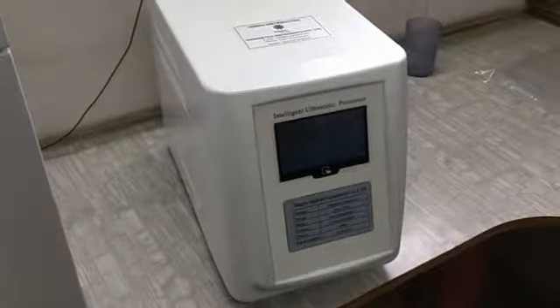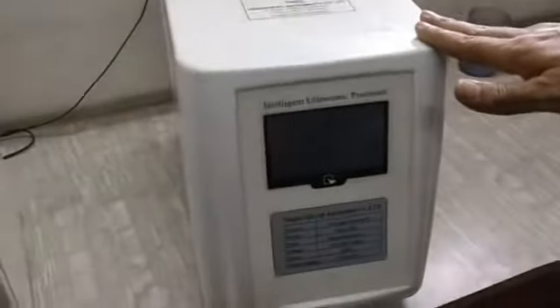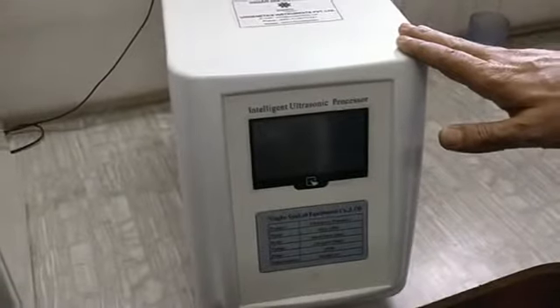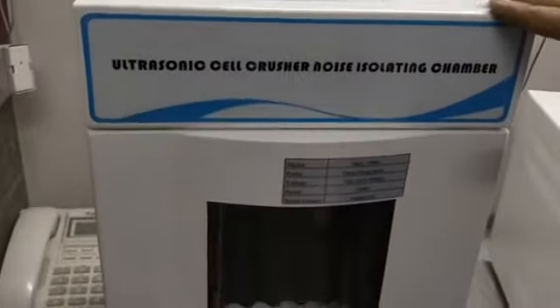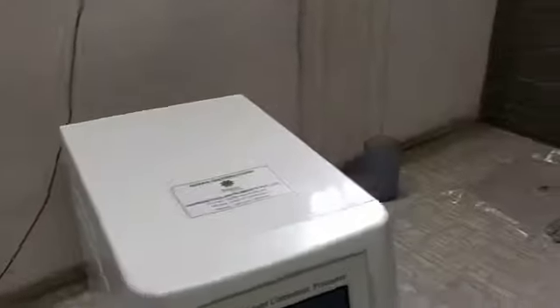This machine has basically three components. This is the main thing, and this is your controller or generator. This is a sound reduction box. If our probe is in this box, the sound will be reduced and it will be very less. And the third part is your probe.